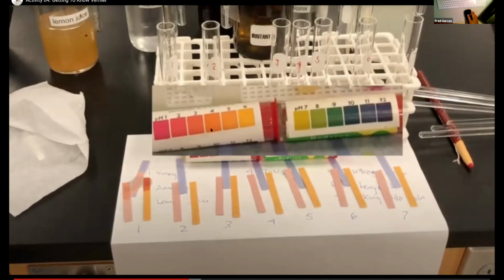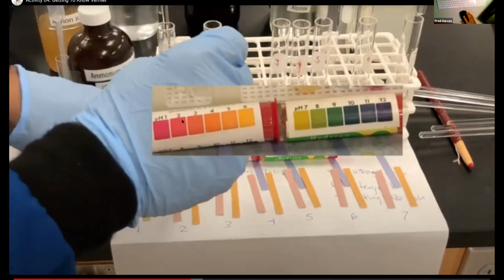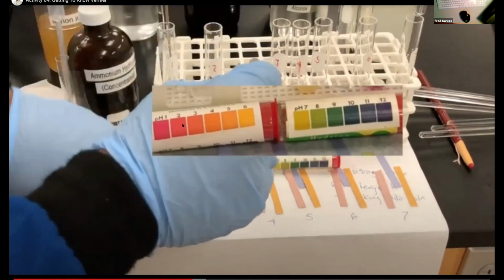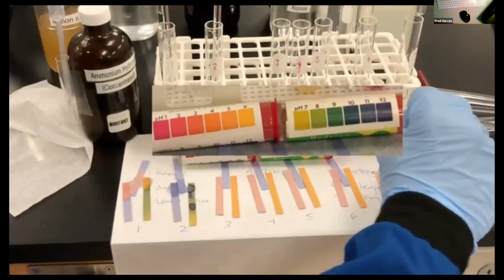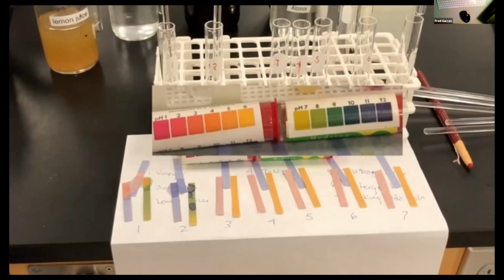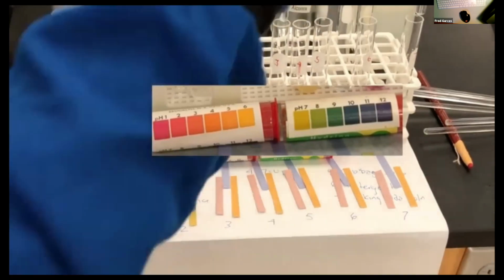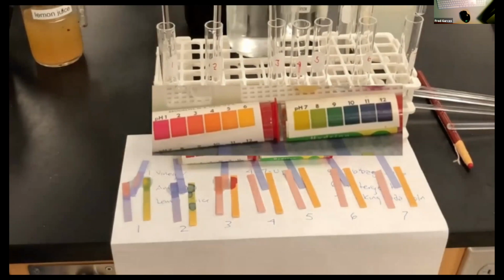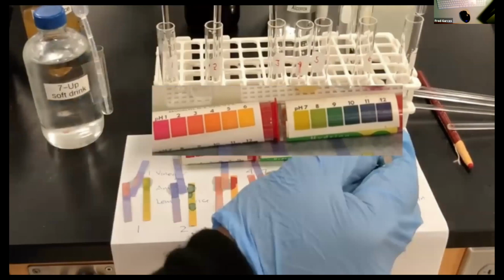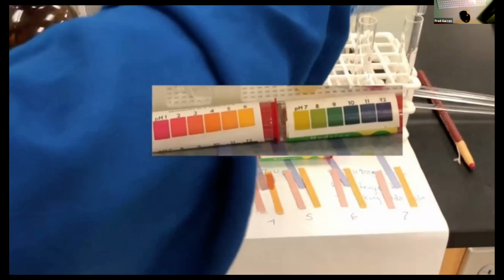And I put an inset of the hydrion paper. The reason why I did that is because notice that I am touching a glass stirring rod to each of the solutions and then wetting the test paper. And when you wet it down, you need to make sure that you can do a reference. Colors may vary depending on your monitor, but they should all vary evenly. That's why I have that illustration of the different colors shown here.